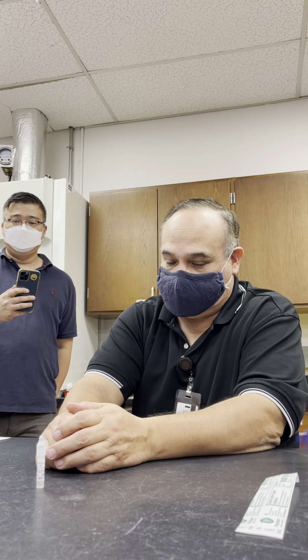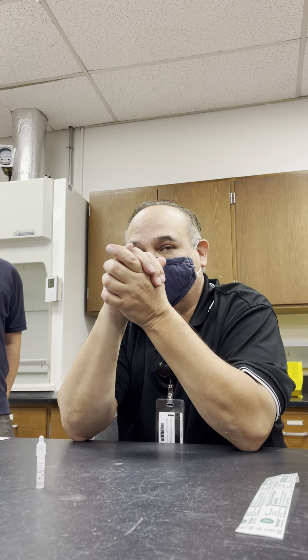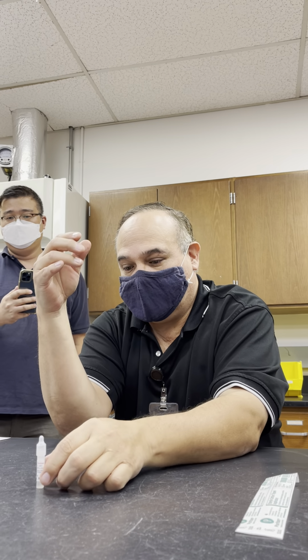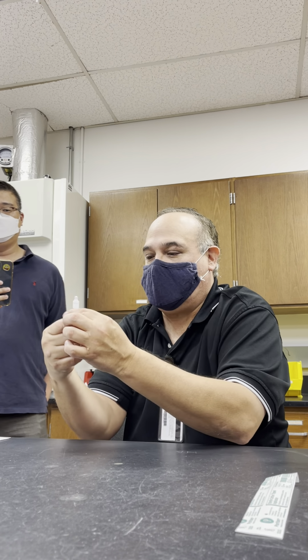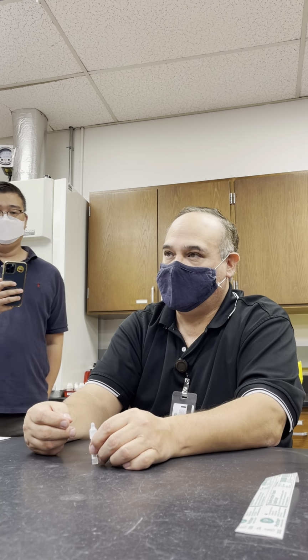Now, another test that we do is the oxidase test. And the oxidase test will differentiate groups into two different categories: oxidase positive and oxidase negative. For the oxidase reagent, we're going to use a spot test. This is what it looks like. There was an ampule in here. I popped it so that all the reagent comes out. The reagent for the oxidase test is this long.